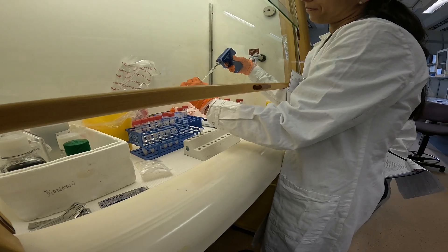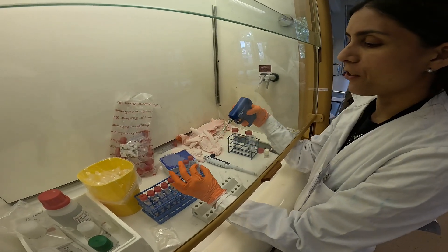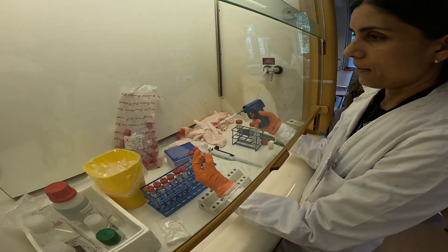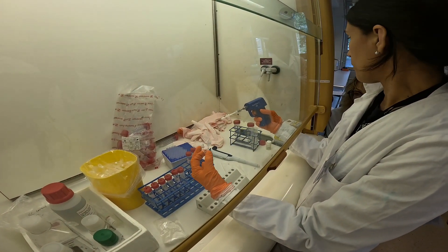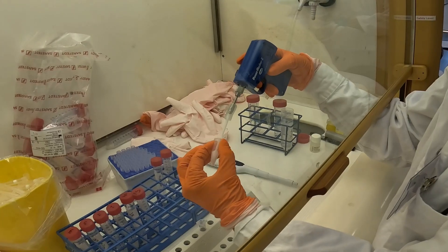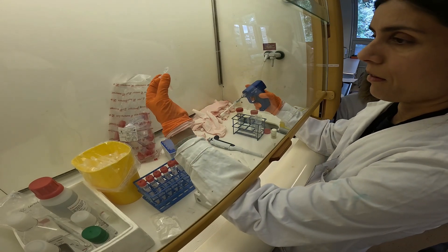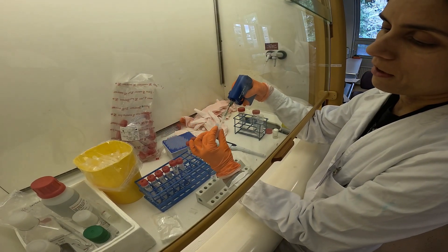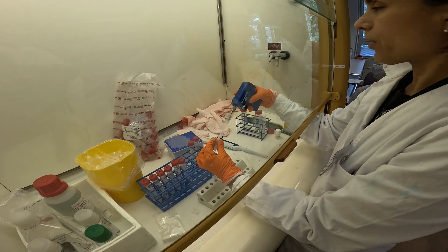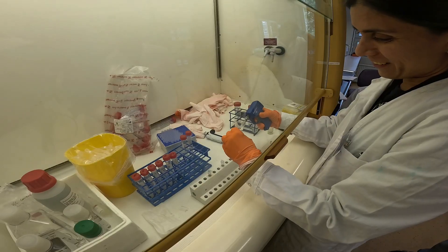This is actually a kind of art, because it's not just introduced and that's it. You have to try to find the tissue because sometimes they just go around. The goal is to crush the tissue, so we try to do this and look around. It is very cloudy already. I can do a little more, but not too much. Like I said on the first day, the protocol says one to two minutes, but we try to avoid that — we think that's too much. It's cloudy, so it's very quick.